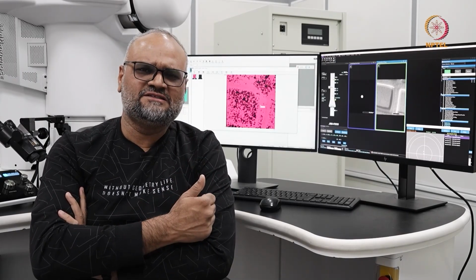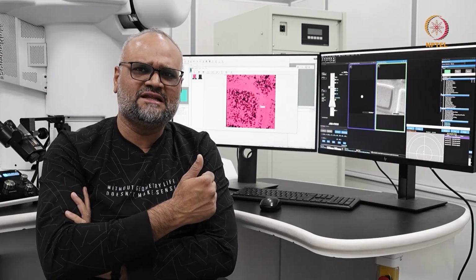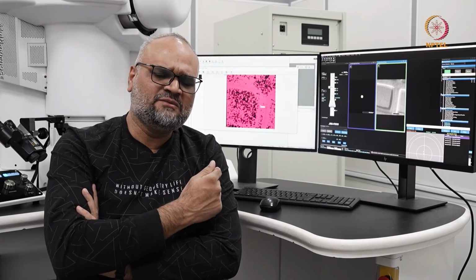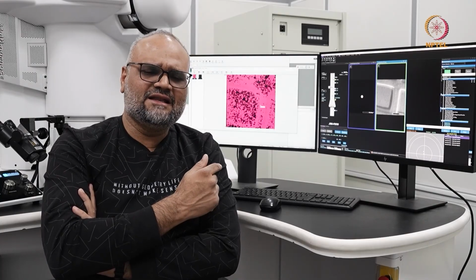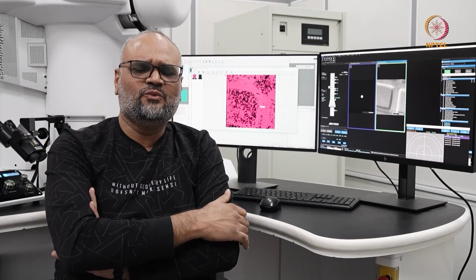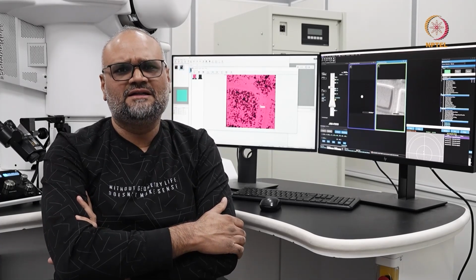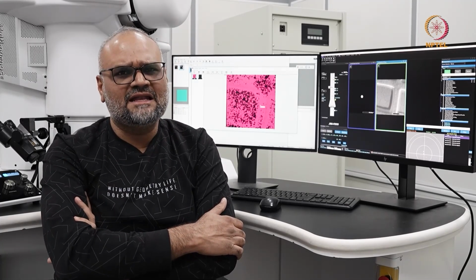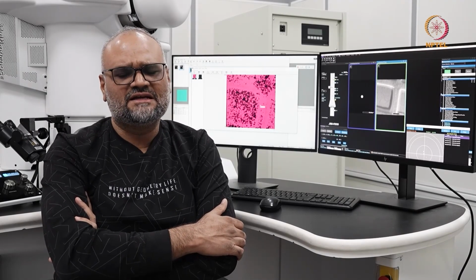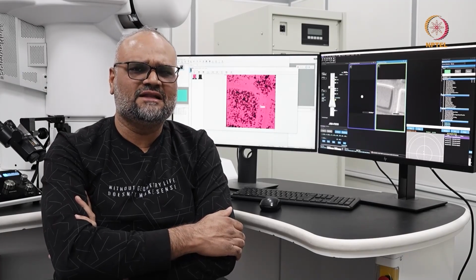On a Thermo Fisher instrument, I have to correct for the rotation center and ensure that the pivot points are aligned and so on. And on the JEOL microscope, I go to the alignment mode and see that I see a near circular shaped region from where I'm getting the ronchigram. And in order to get the ronchigram, please ensure that I'm not scanning the beam. I'm in a stationary mode and go to an amorphous area. And from the amorphous area, please ensure that your ronchigram is well corrected.